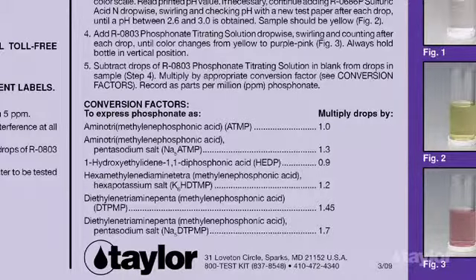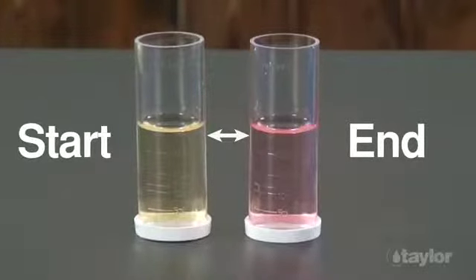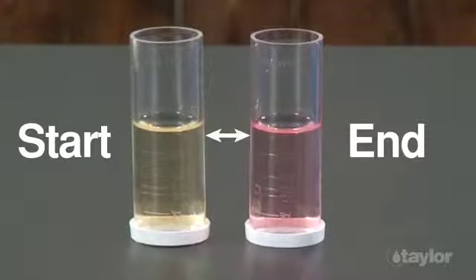Both tests require adjusting the pH of the sample. This step distinguishes our method and is important because the correct endpoint will not be reached unless the sample pH is adjusted to the specified range. In this video, we demonstrate the proper way to perform a drop test for phosphonate using the K-1583.